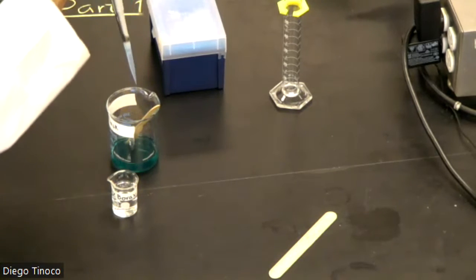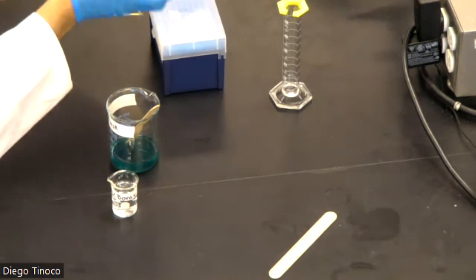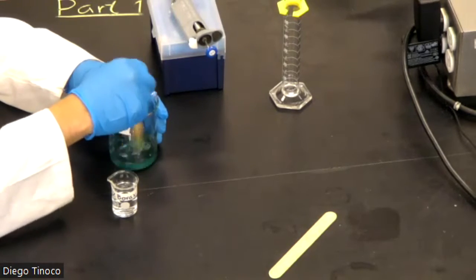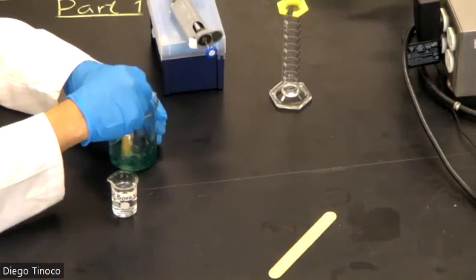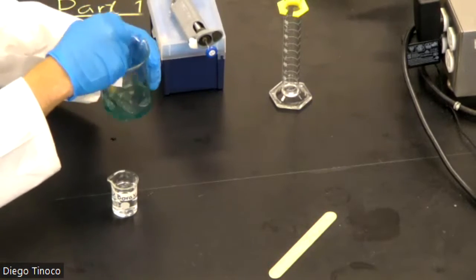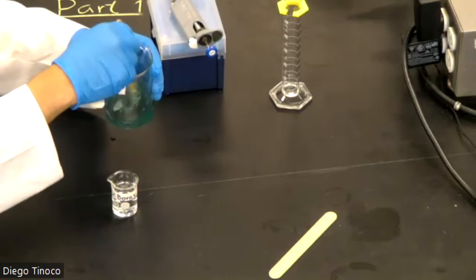First stop, second stop. Now we're going to set this aside and mix right away. Now you want to make sure that you're mixing. We're aggressive, but we want to make sure that we mix as well as we can. You can do circles, and then go from circles to up and down, side to side, and continue like that.